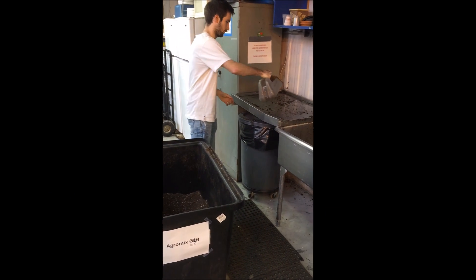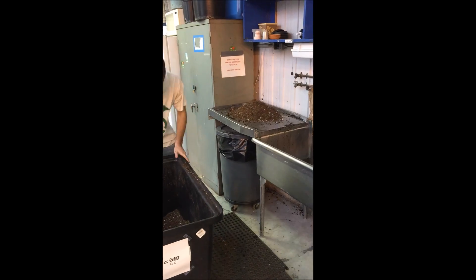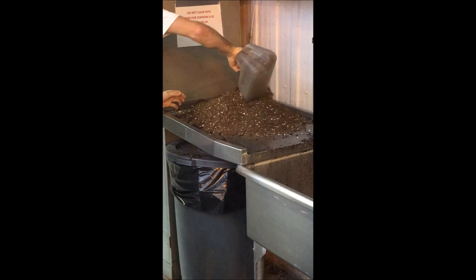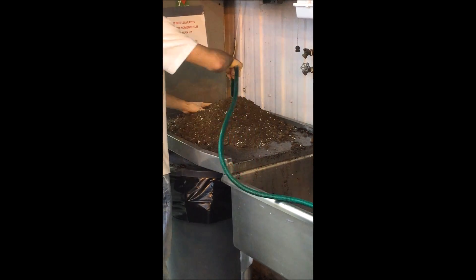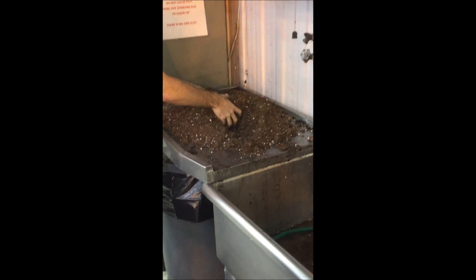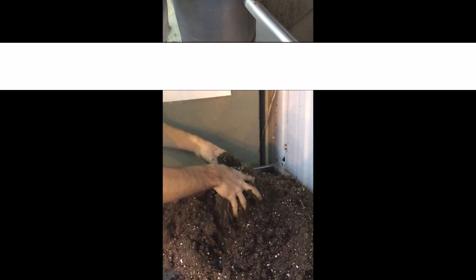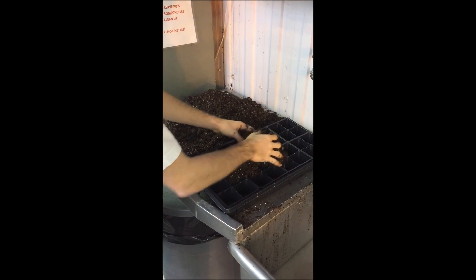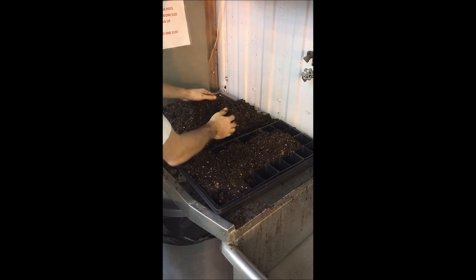First of all, prepare a clean G6 substrate to support seedling growth. Add water to moisten the soil properly. Mix the soil using your hands to increase the soil-to-water contact. Then fill up the trays with moist G6 soil and press firmly to distribute it evenly.